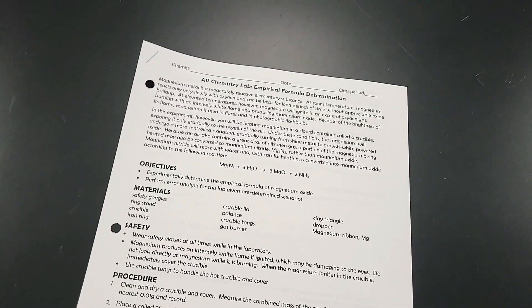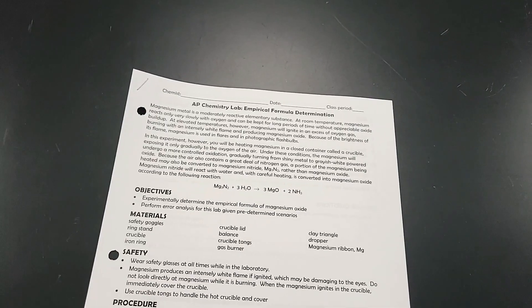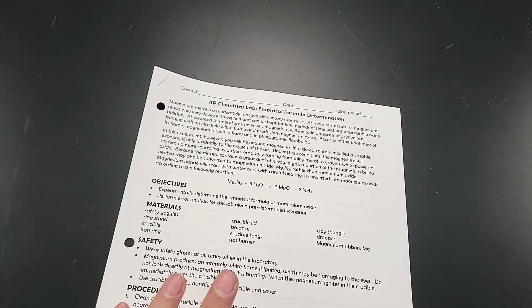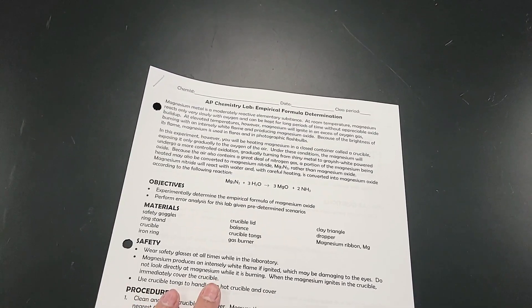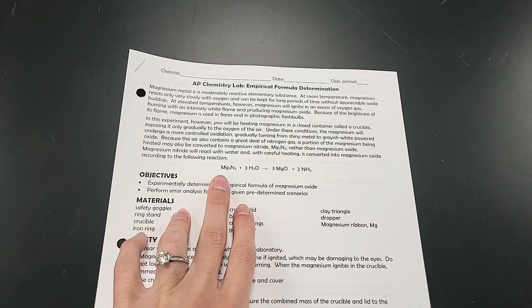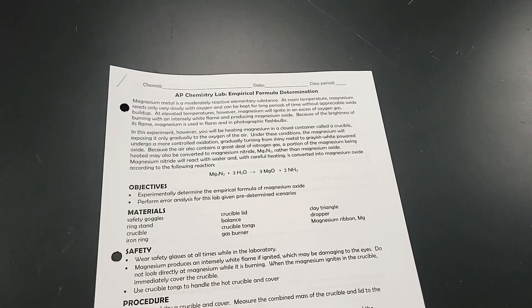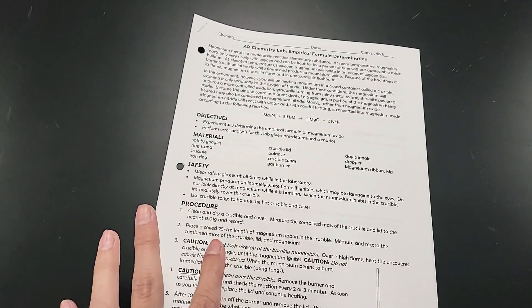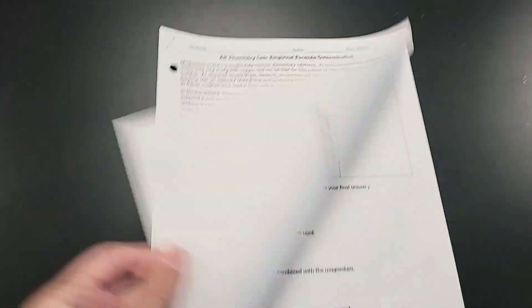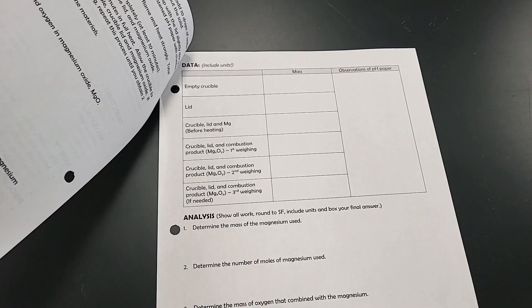This is the lab we're doing today — just a really simple empirical formula lab. I do this in CP and honors as well, but the AP version specifically focuses on the fact that magnesium also reacts with nitrogen in the air, and I have them do some error analysis questions after their calculations.